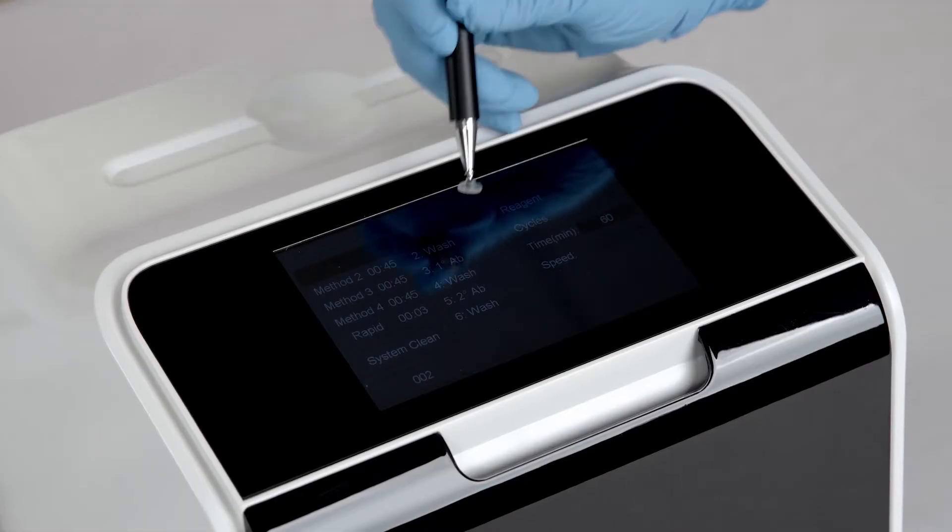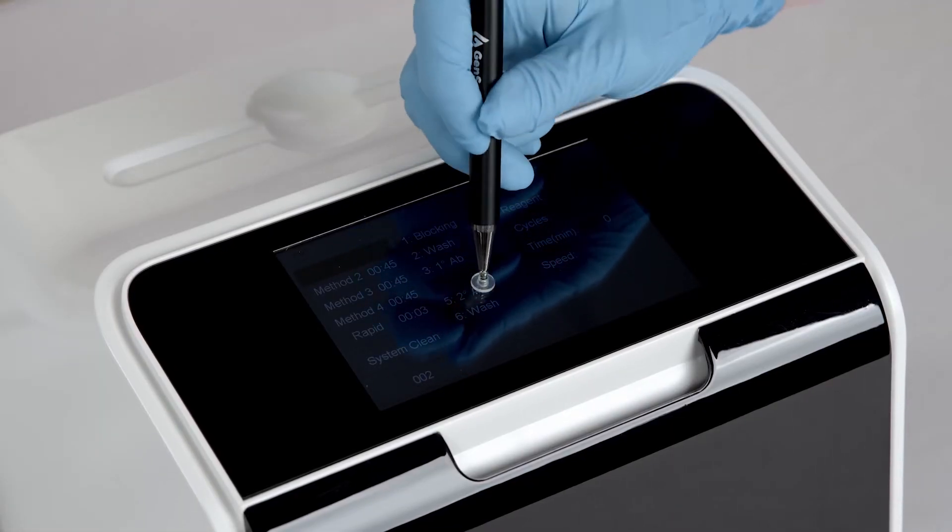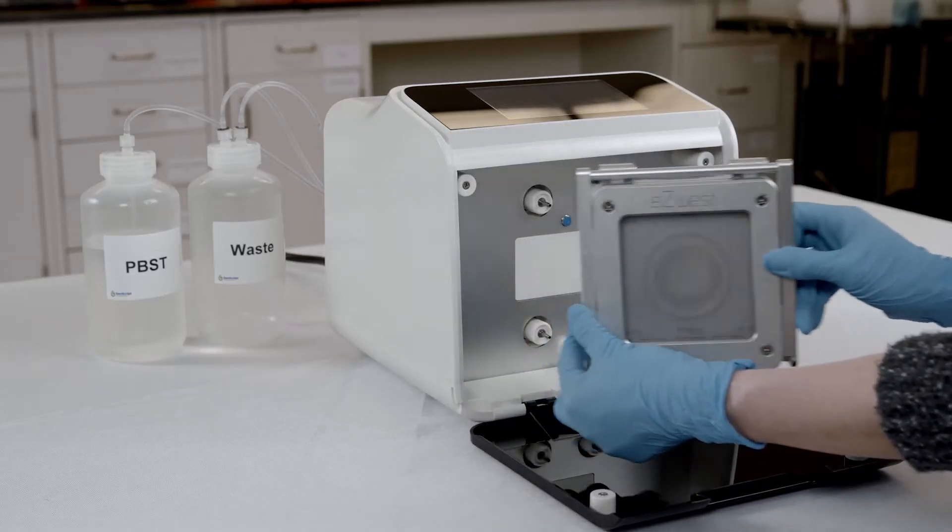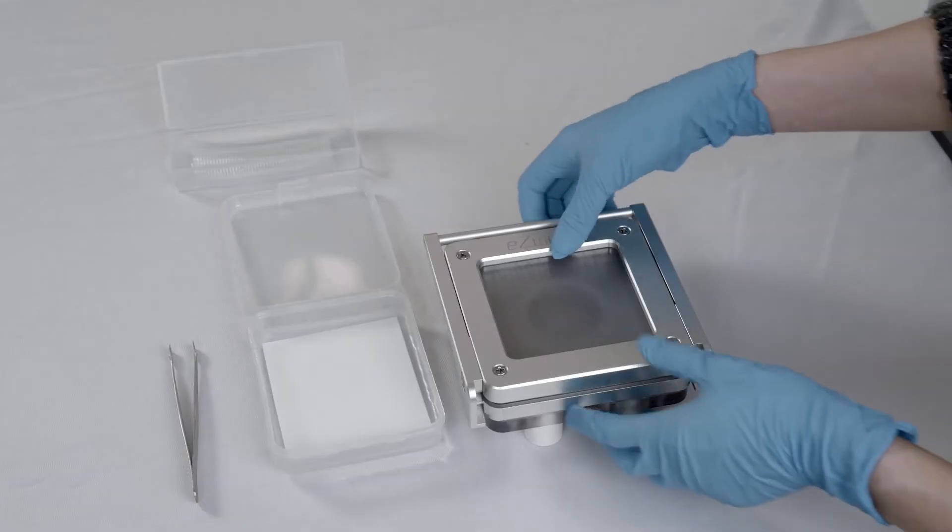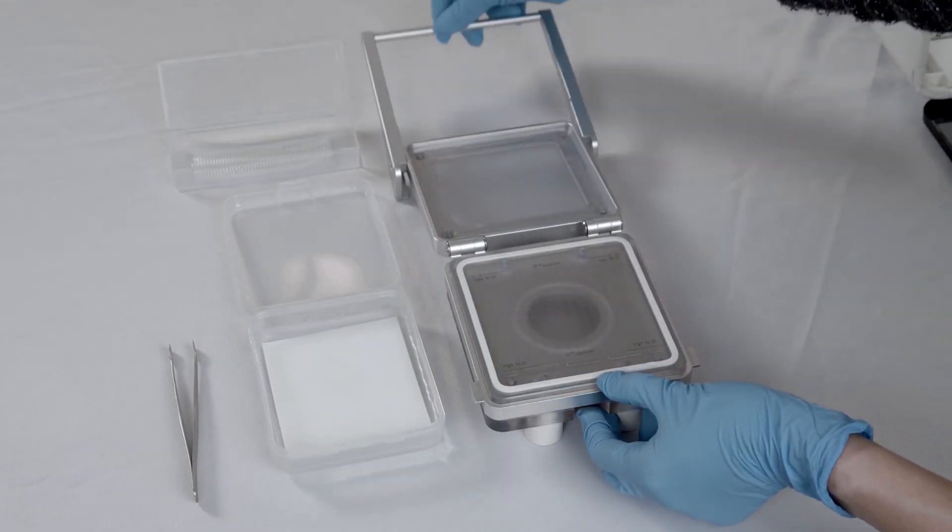The user-friendly touchscreen interface allows customization of the Western protocol. Once all reagents are loaded, take out the cassette for loading the membrane. Open the cassette and note the markings on the surface. This includes the placement position of the membrane and the spacers.